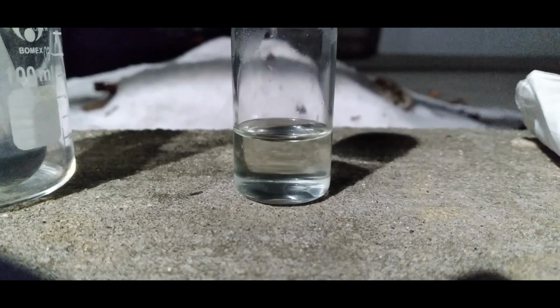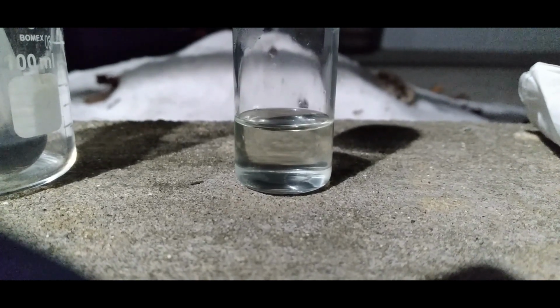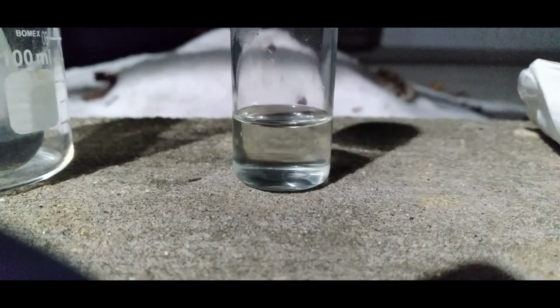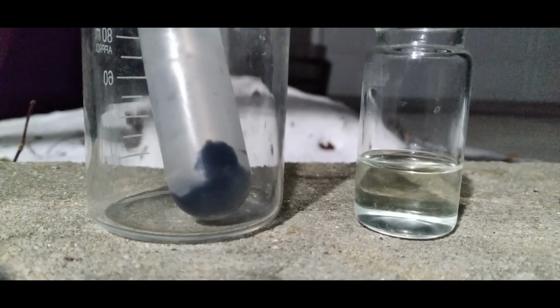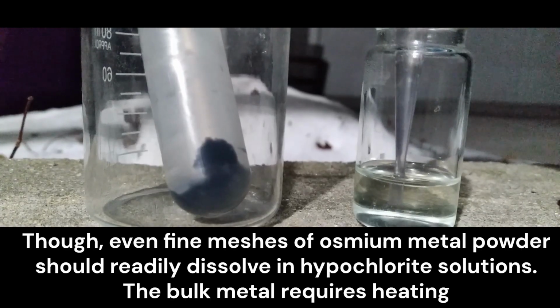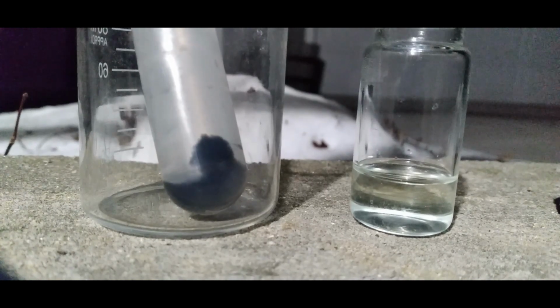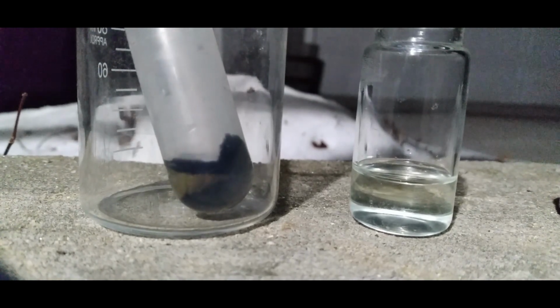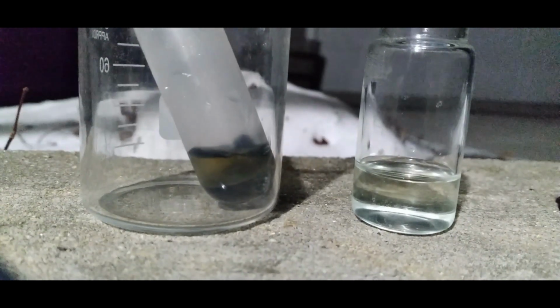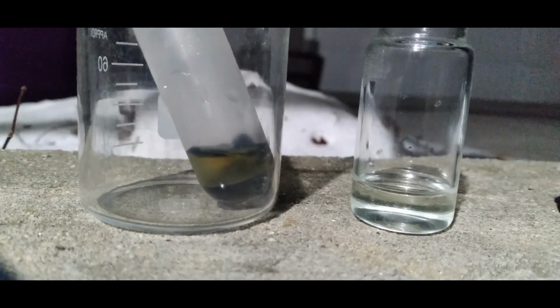To oxidize the osmium dioxide, I will be using bleach containing a great excess of sodium hydroxide. This is to prevent it from over-oxidizing. Because the osmium is already in the +4 oxidation state, no heating is required for this reaction to occur. Immediately, a green color is noticed in solution, and this is from the presence of sodium osmate. Usually, sodium osmate solutions are red, but they can be any color depending on solvent and concentration.